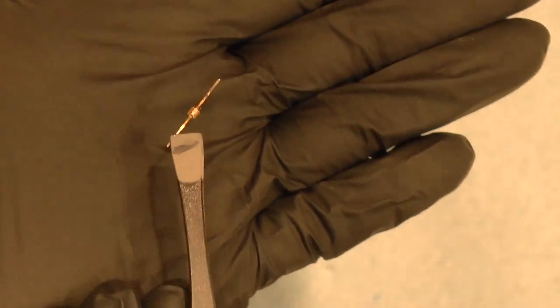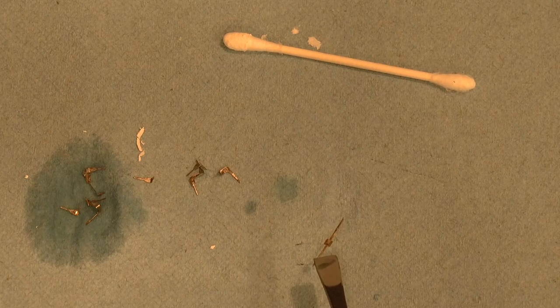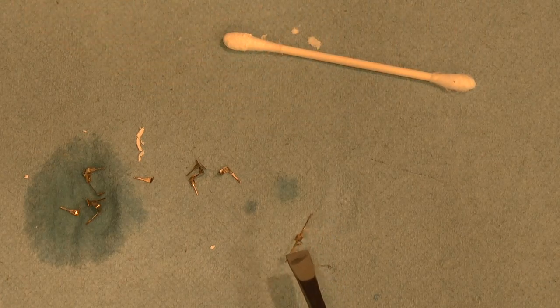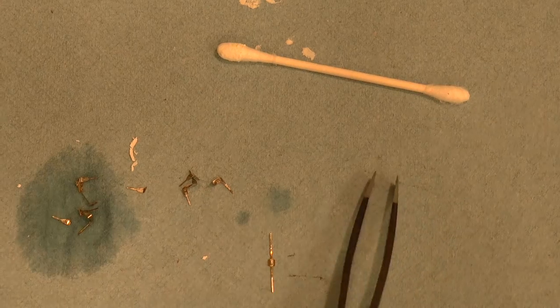And I will attempt to get the camera to focus on the die. It's very small, but it's there. And that's really it. That's how you decap a chip with hot sulfuric acid.